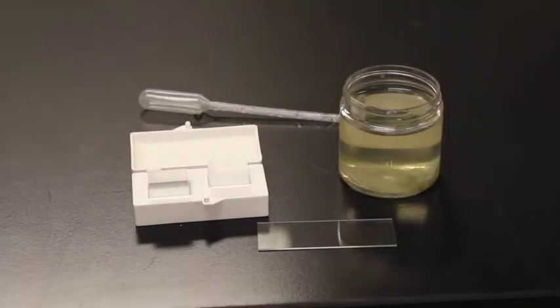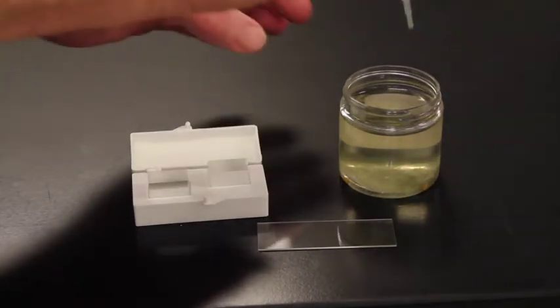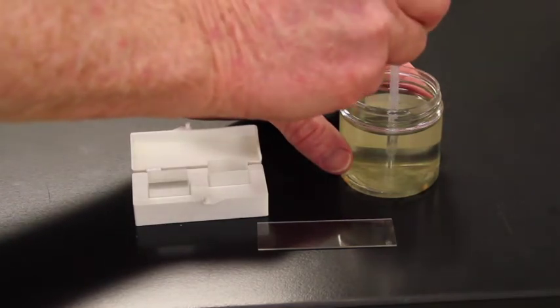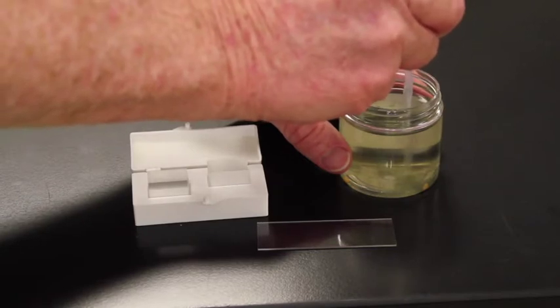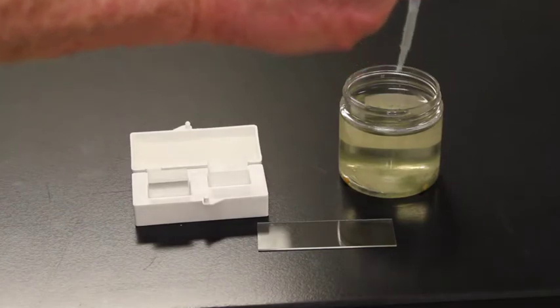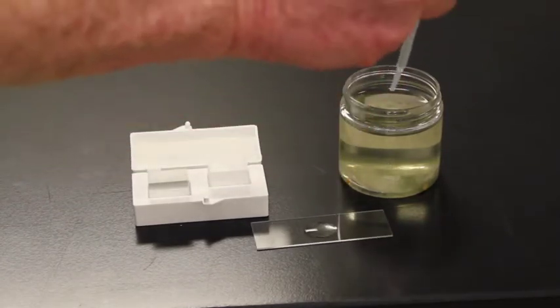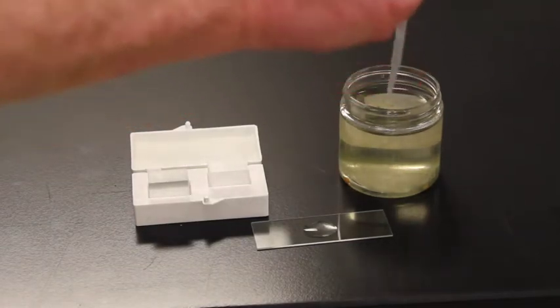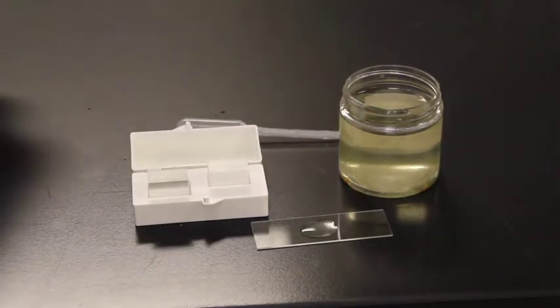I'm going to turn it around this time so you can actually see all the debris in the bottom. These guys, again, are heterotrophic, so they're hanging out in the bottom. And what I want to do is get in and carefully suck up the muck off the bottom. I'm actually going to drop a few drops out so I really get the muck when I put it on this slide. A little bit more here. There we go. Again, I'll put the lid on.